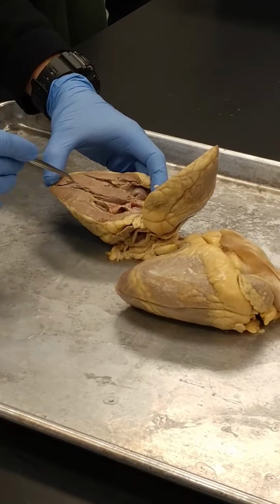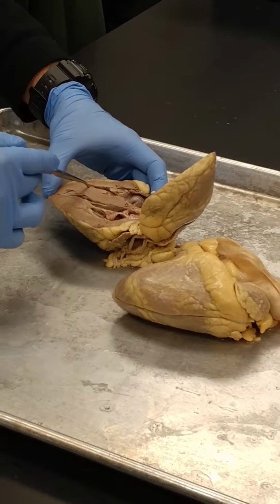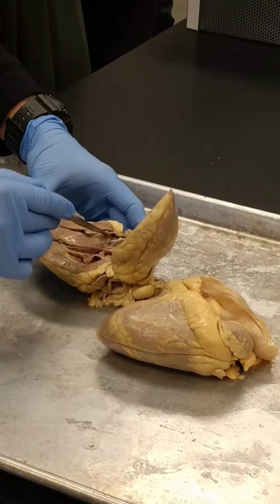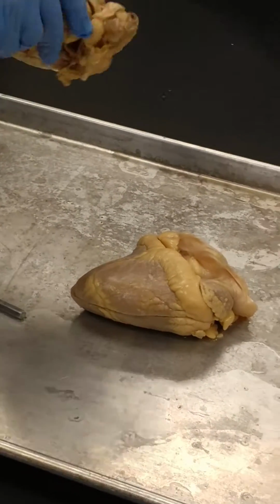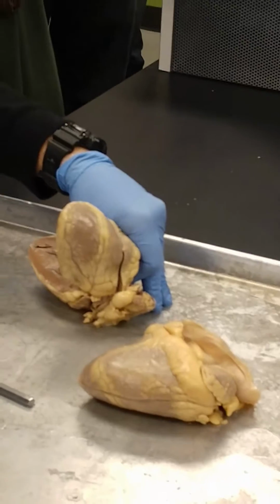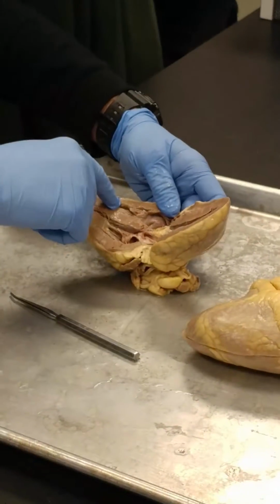If you open this up, the way you get your bearings, this is called the interventricular septum. Then this is the wall of the left ventricle, and this is the wall of the right ventricle. So ventricles down below. The right atrium is this structure right here. Where my thumb is, that's the right atrium. This one is going to be the left atrium. Alrighty, so now we covered that. The two ventricles, we just talked about those: left ventricle, right ventricle.